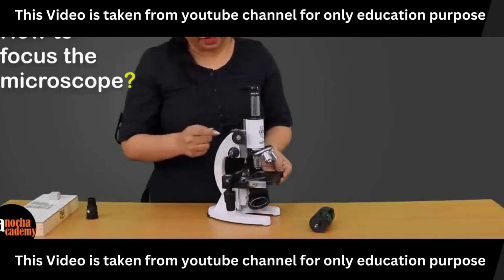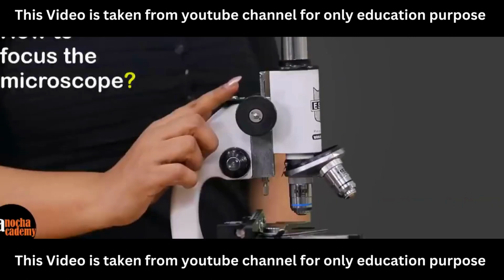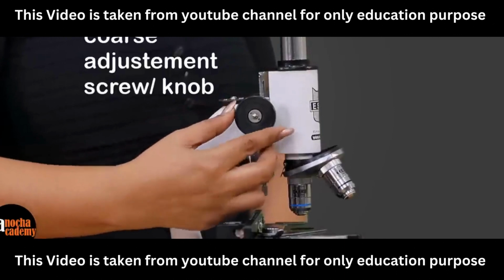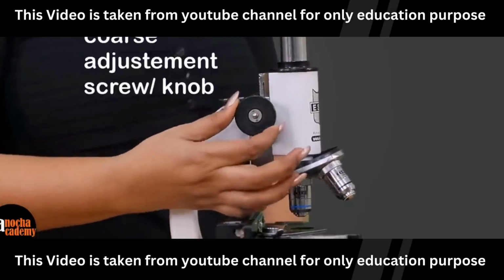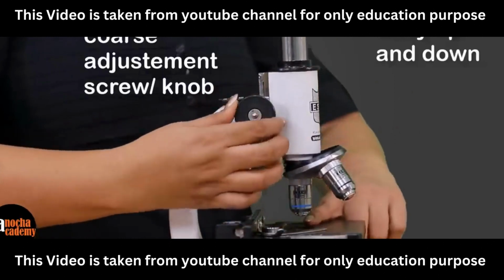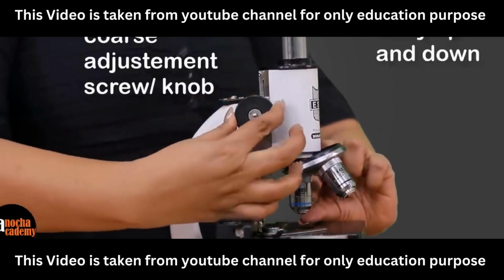For that we have these two screws. The first one, which is this large one, is known as the coarse adjustment screw. If you see this one and if you just rotate this one, you can clearly see that the body is moving up and down along with the lenses.